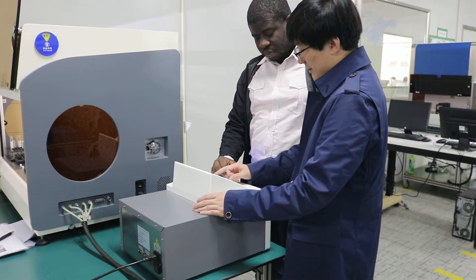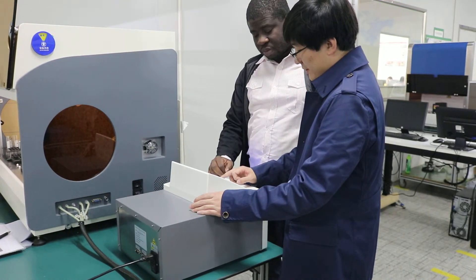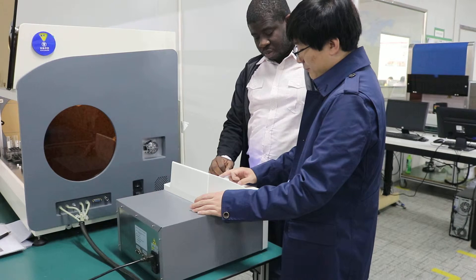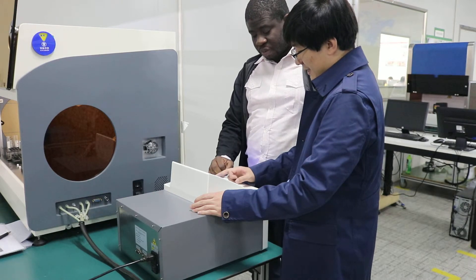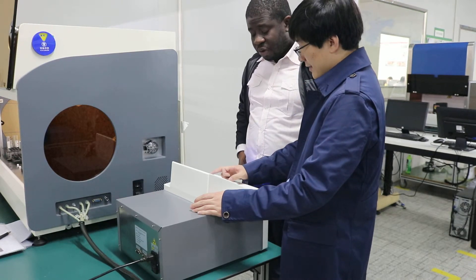Usually there is 0.05. This one is the first one. This one is the third one. And bigger than the cut-off — this is the case.